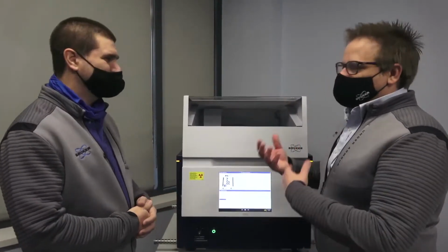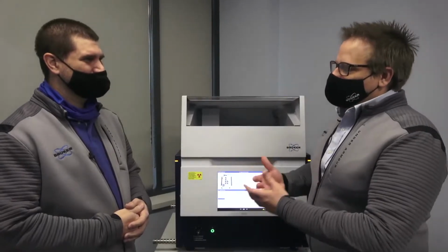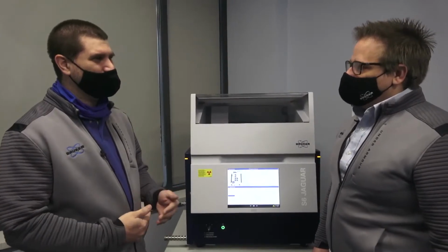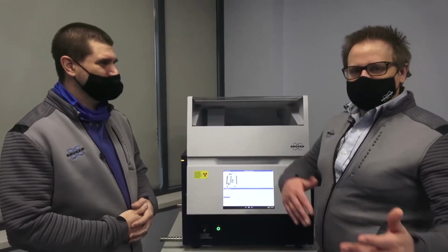Okay, so we don't have to worry. The sample is completely unchanged and it's kind of non-destructive in that regard. You're right. You can actually run that sample over and over again if you wanted to. Okay, if we wanted to check historically what was going on.